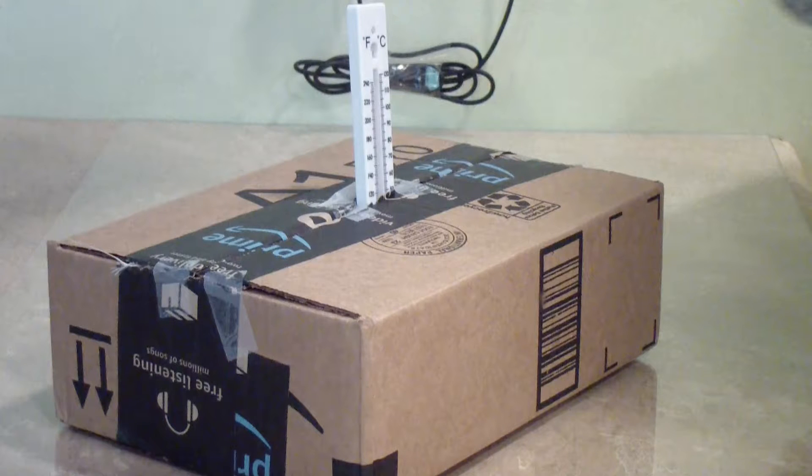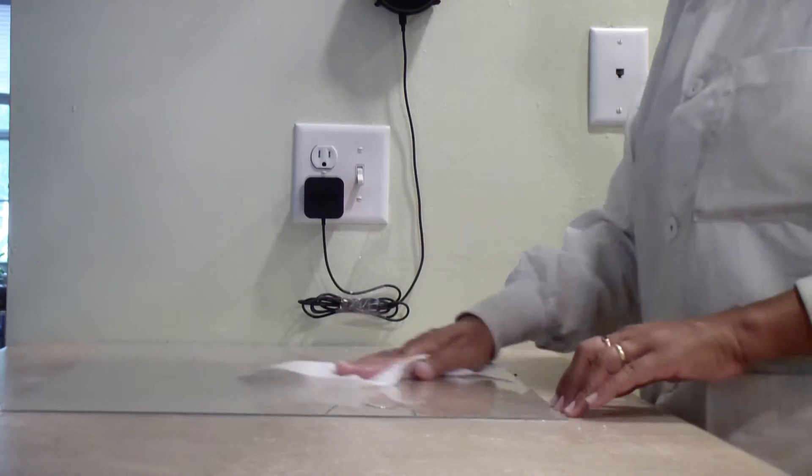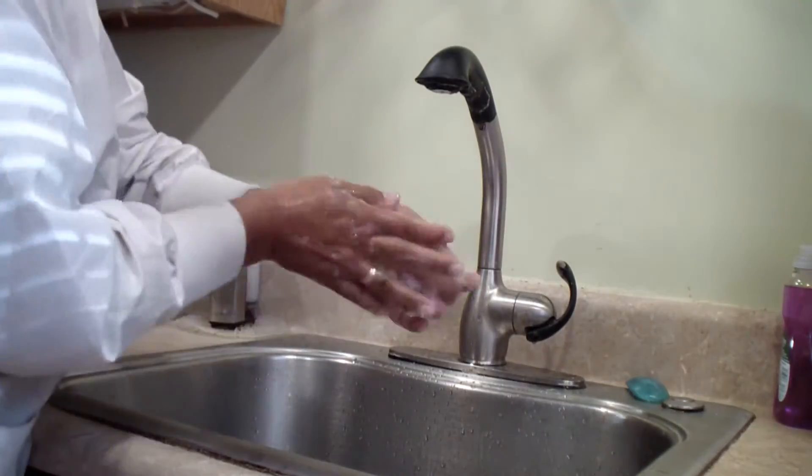Incubate your plate as you normally would, recording the temperature every day. Wipe down your bench again and wash your hands.